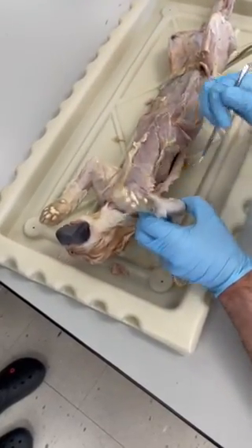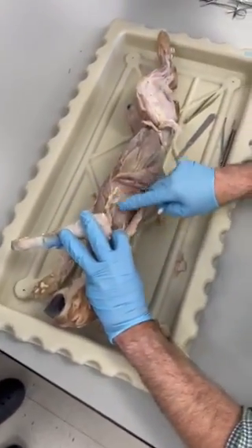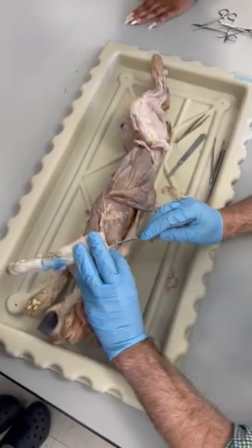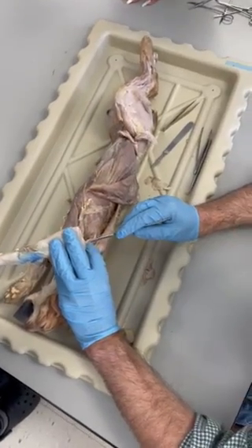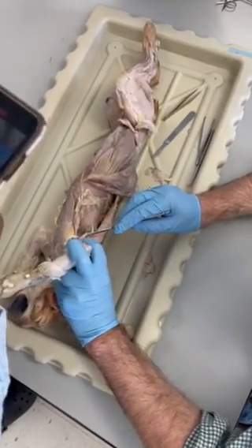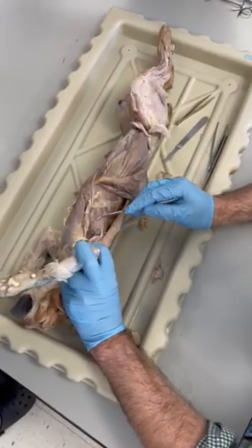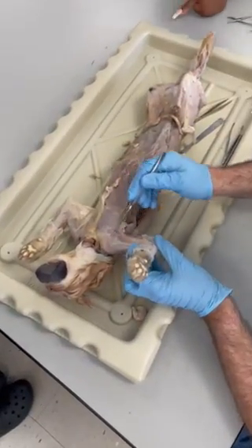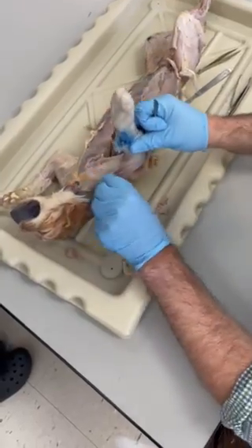Okay. In the armpit, we've got the serratus anterior and the teres major. Where's that one? Teres major? Yeah, it's hard for you to see from behind the elbow. See that? Teres major, serratus anterior. Deltoid. See it wrapping around the outside of the shoulder, deltoid.